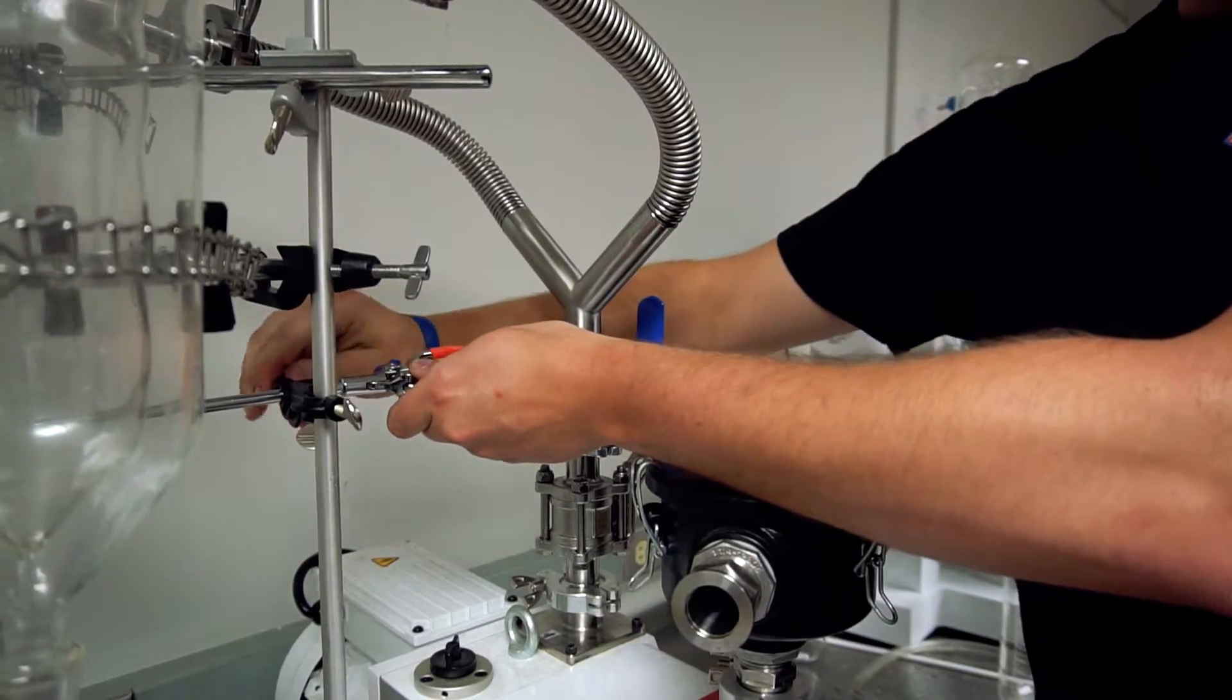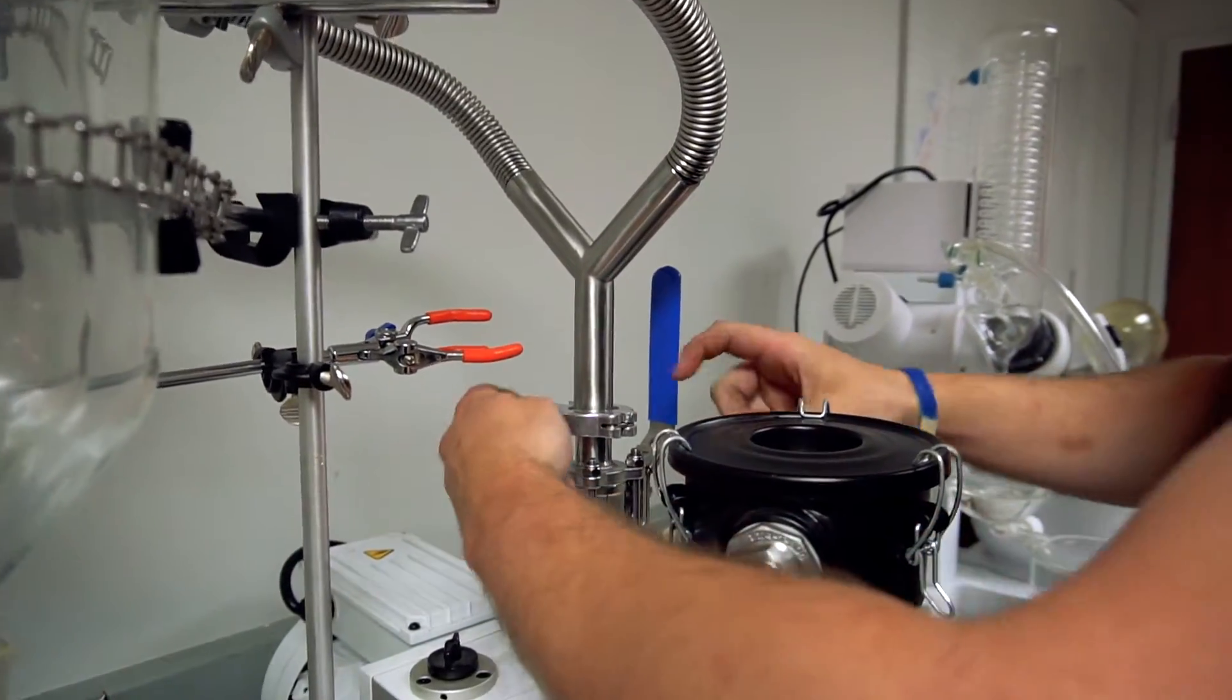Although I would recommend adding a bullseye gauge in here somewhere, maybe a vacuum manifold on the pump.